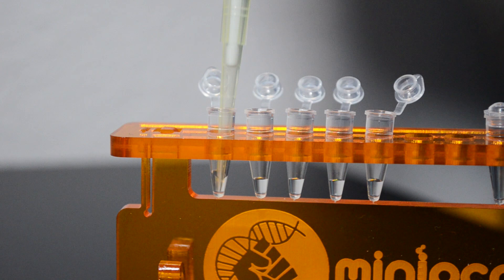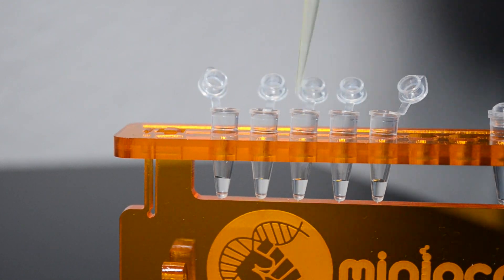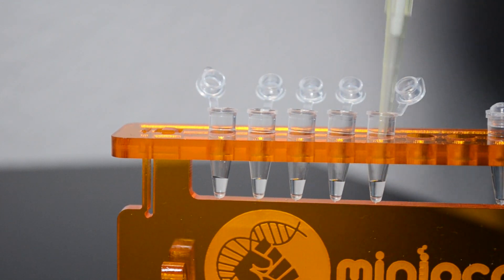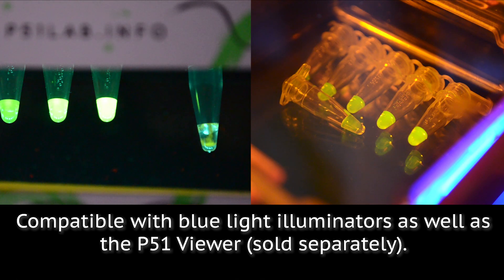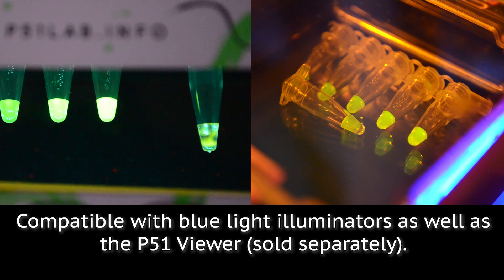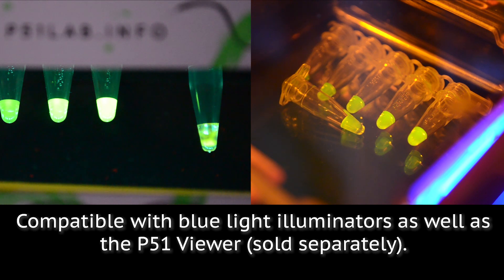This simple, easy setup allows different groups to each pursue their own unique experimental design, all with minimal preparation time and a bright, easy-to-see readout. This lab is compatible with blue light illuminators as well as the p51 viewer.